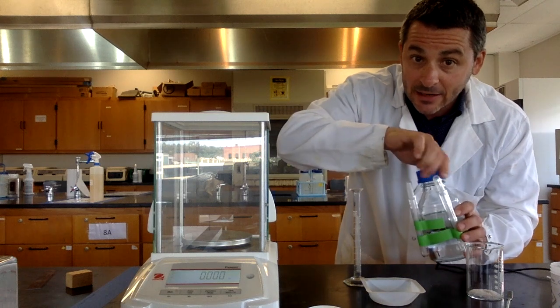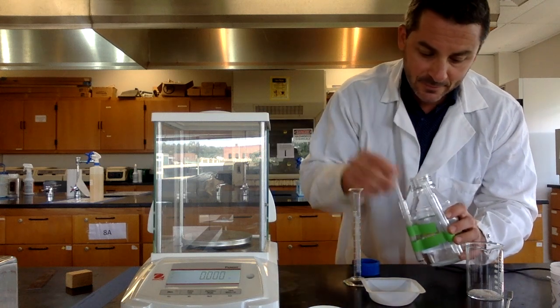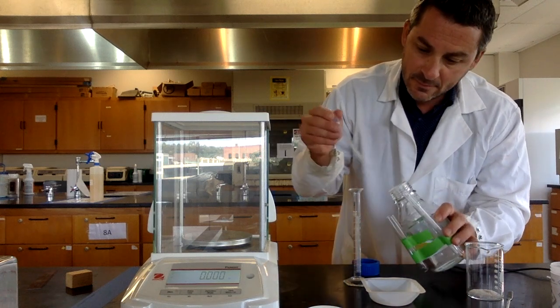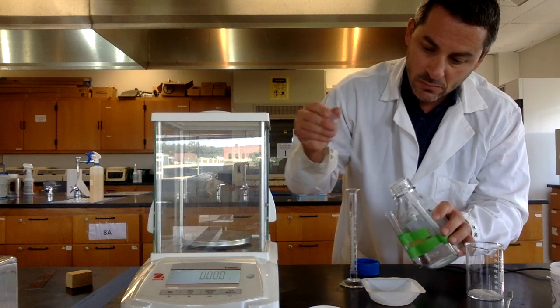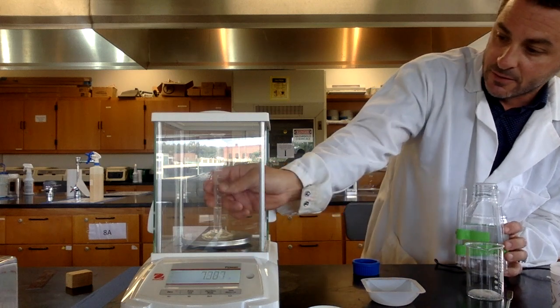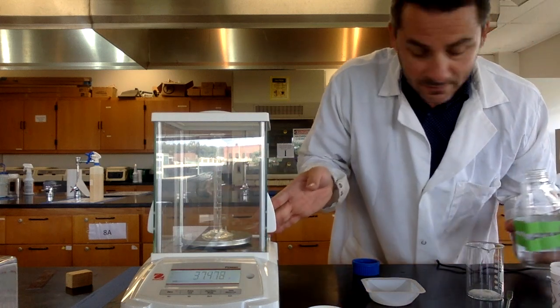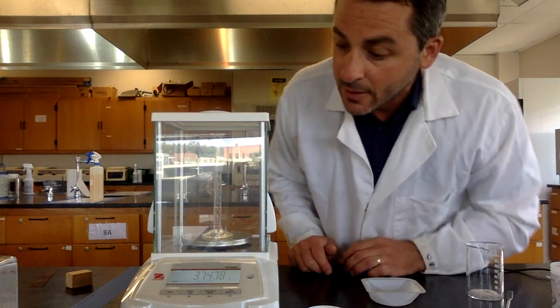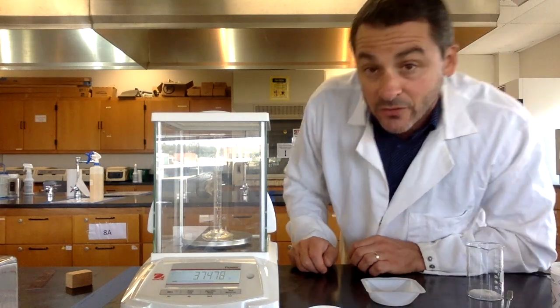I take this off. I add my liquid. And then I place it back on the balance. Now I can record 37.478 grams.